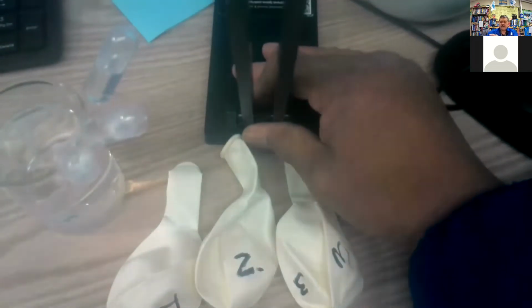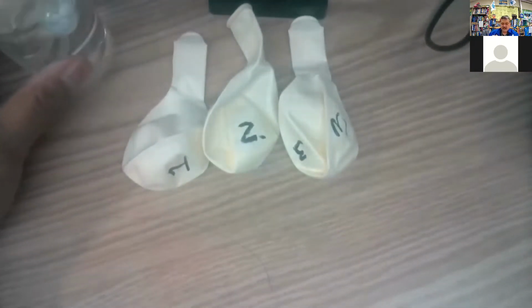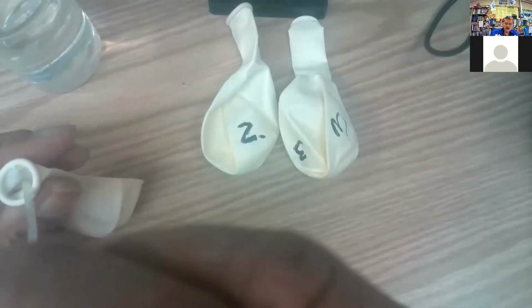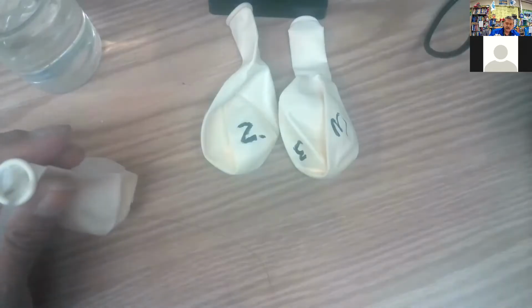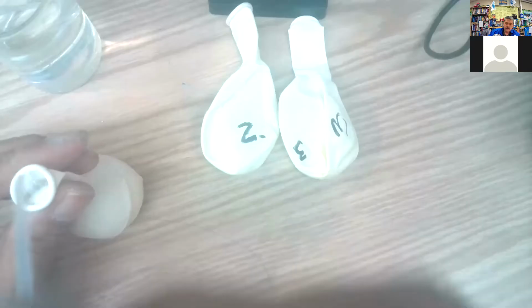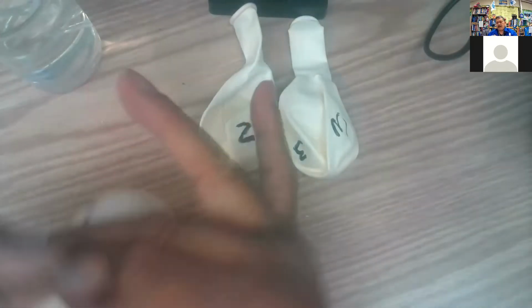Okay, so let's see that. Are you ready? Okay, here we go. One. Squeeze that one too. Oh man, I have a little bit coming out already.